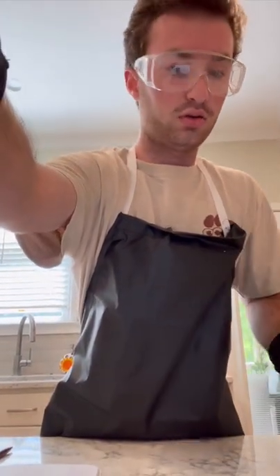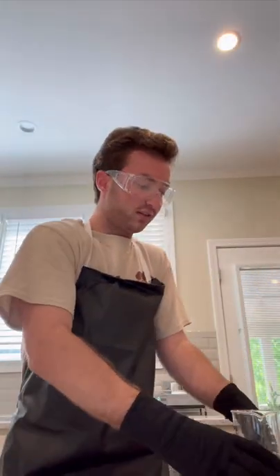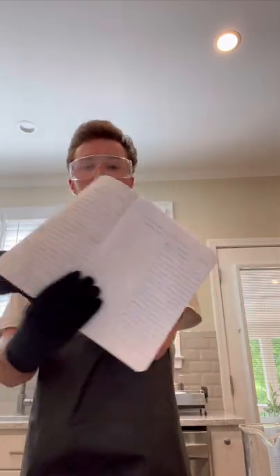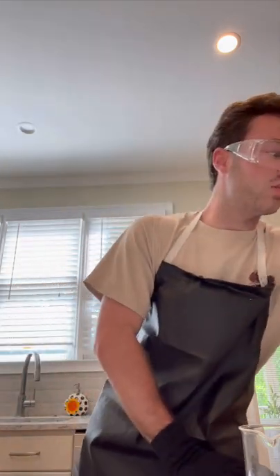Once I get going into the actual reaction, I'm going to reset the balance and mass it. I'm going to use this beaker for stabilization of the test tube. I've already massed the beaker and it's been tared, so it helps balance the test tube on the beaker. Once I get the mass of the cupric sulfate, I'm going to record it here in my notebook. Then I'm going to do the exact same thing with my sodium carbonate, which I also have measured out in a 3 milliliter test tube.